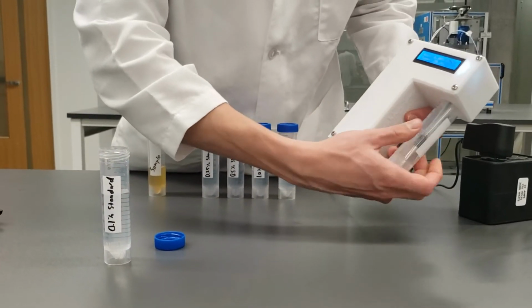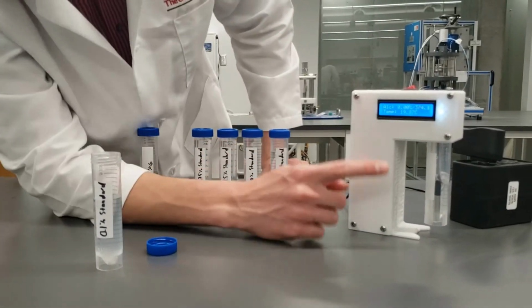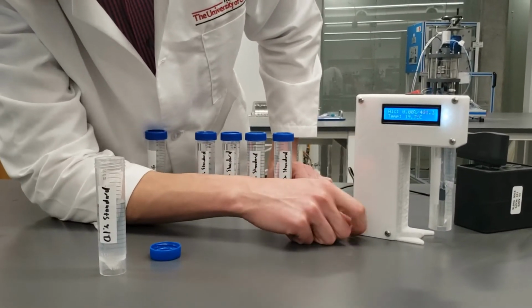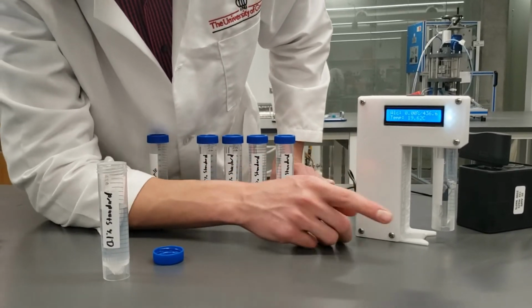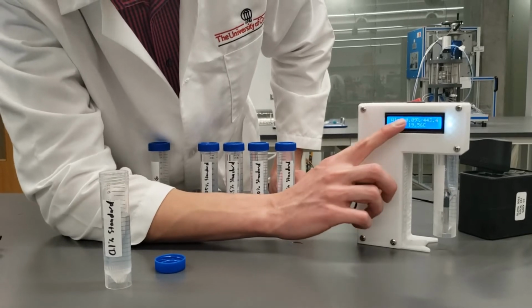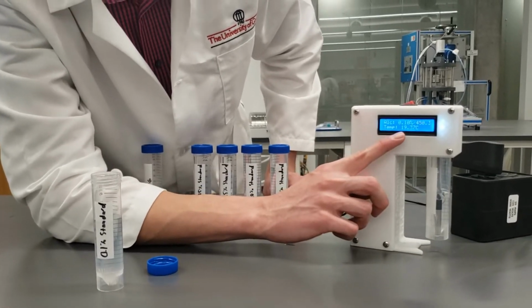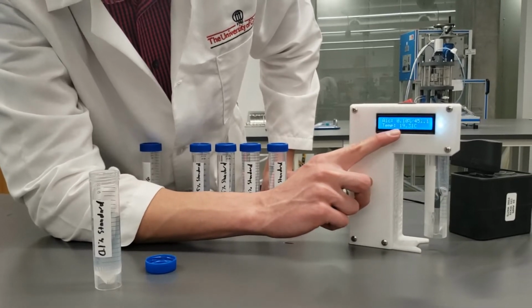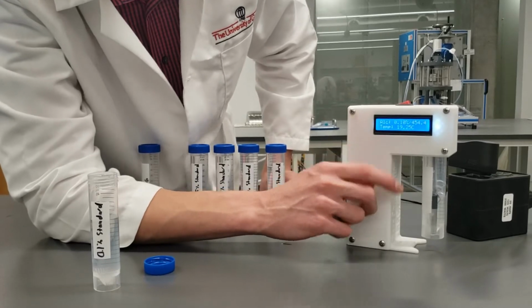We're gonna screw it into the detector, and we're gonna wait for a reading to come up on the screen. Now, again, we're not going to be looking or caring at all about this percent reading. So it happens to be just about perfectly right. That this 0.1% is actually 0.1%.